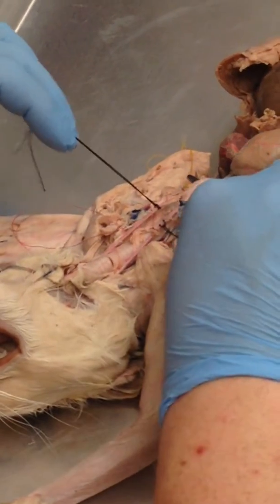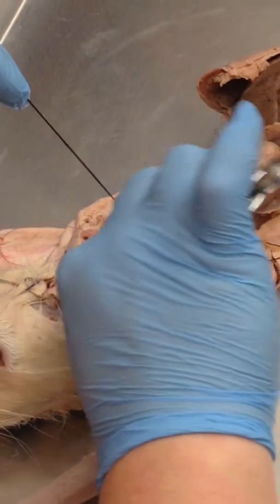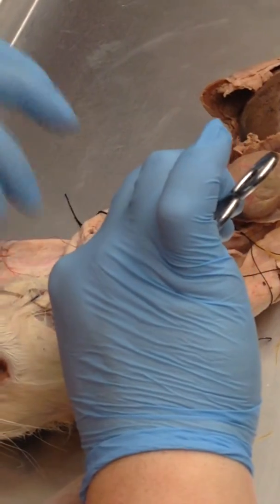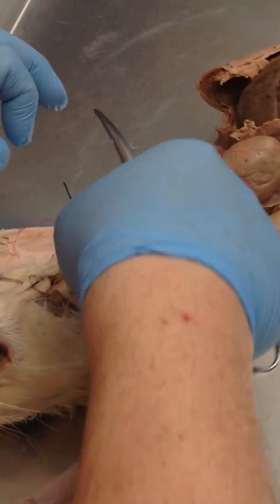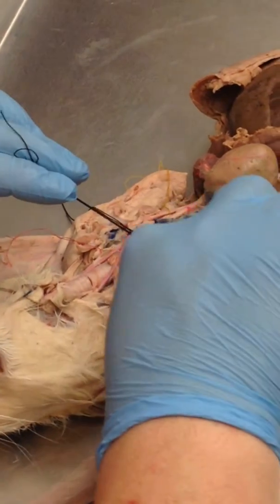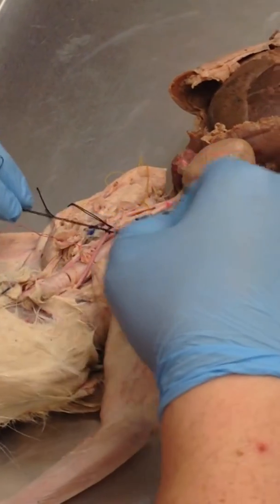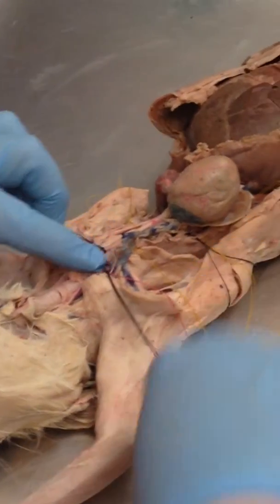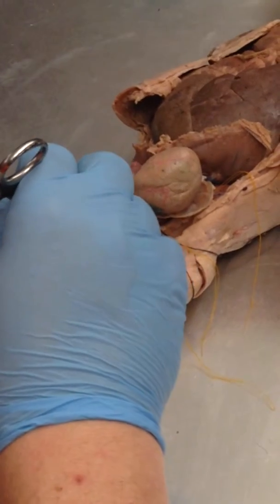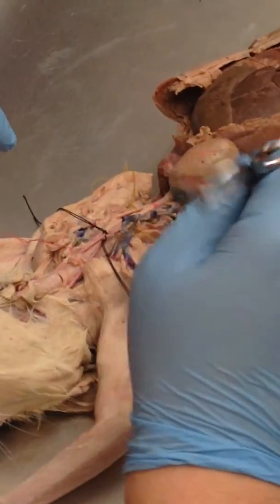The brachiocephalic trunk splits, so you have the left common carotid, just follow it all the way up to the left side of the neck. Again, you see the vagus nerve runs along that. You've got the right common carotid, which is always your middle branch out of there, and then your right subclavian, which is this one over here. It goes out to the right arm. So on this one you have the left common carotid branch off first, then you've got the two right sides branch. All right, so again, there's always variation.